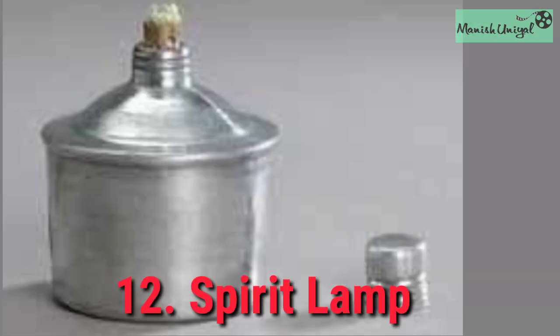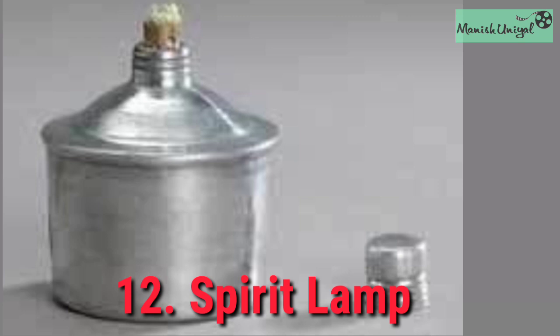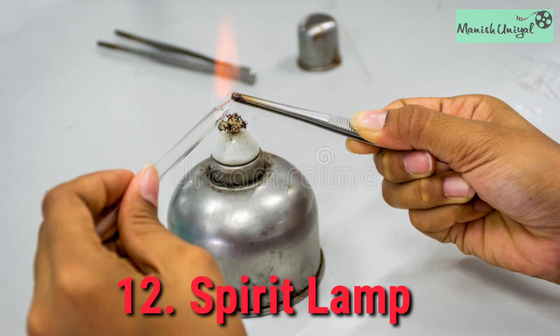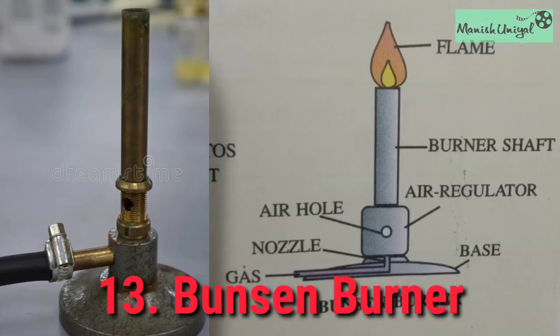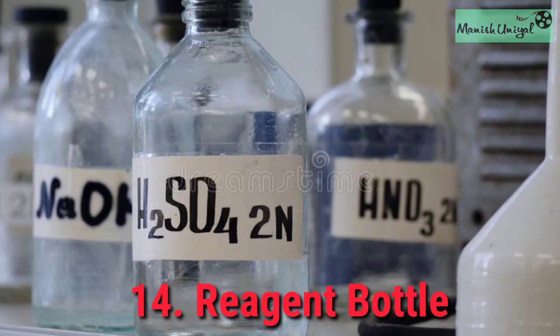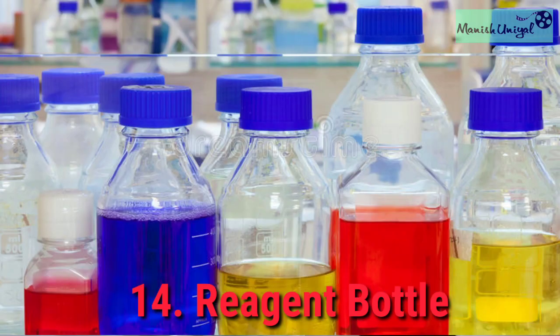Spirit lamp: a type of burner made of glass, brass or steel containing a wick; spirit is used as fuel. It is used to heat substances. Bunsen burner: a burner that uses gas as fuel, used for heating purposes. Reagent bottle: made of white or coloured glass, used for storing chemicals. Gas jar: a glass cylinder used for collecting gases.